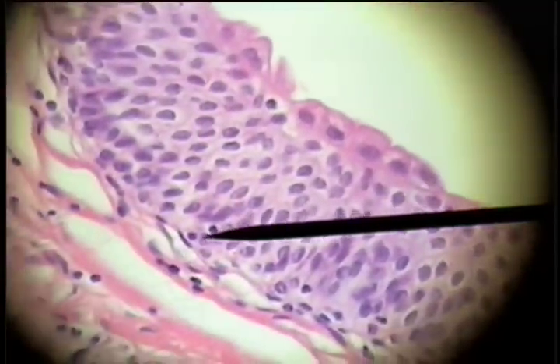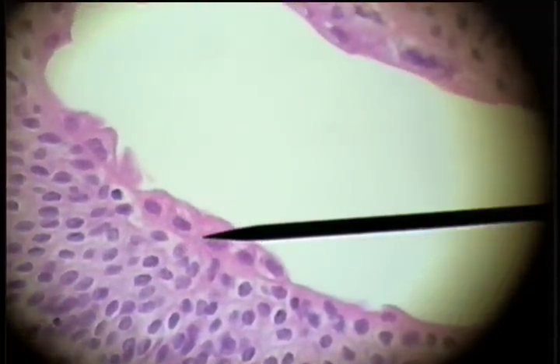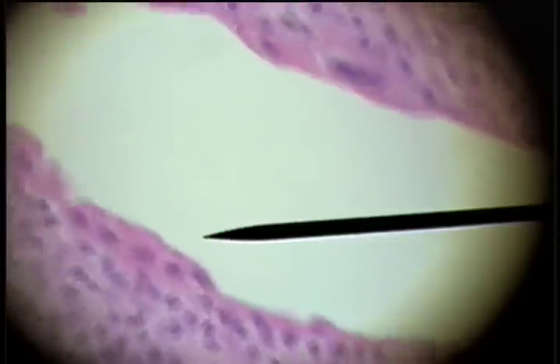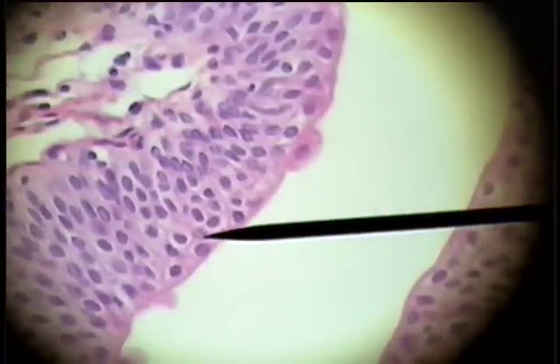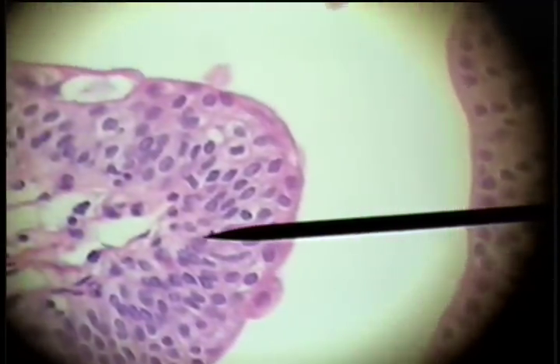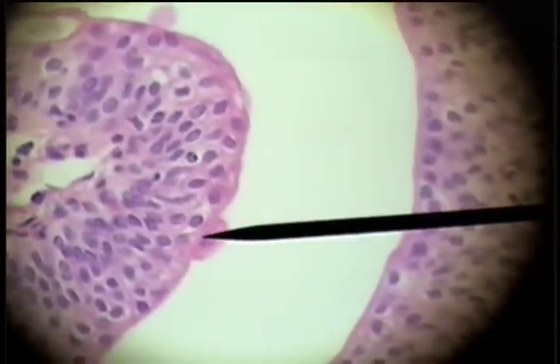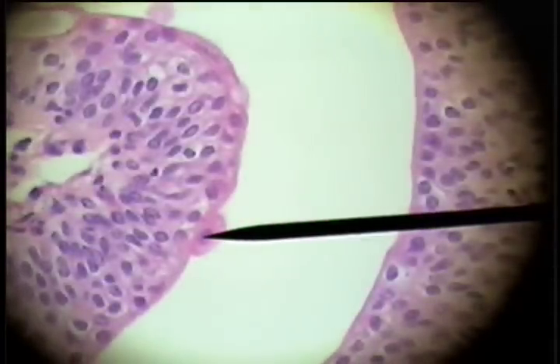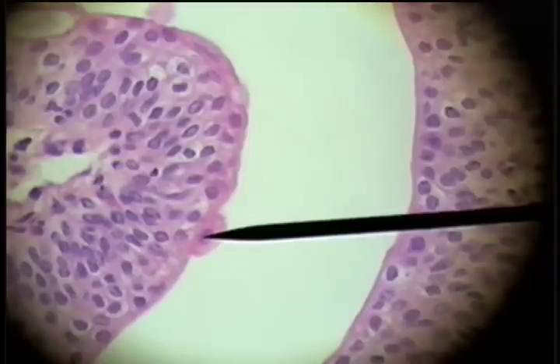We'll see maybe six or seven cells stacked on each other with these large round balloon cells on top, and that's characteristic of transitional epithelium found in structures of the urinary tract. There again is the basement membrane, six or seven cells, and then a balloon cell or large bubble-like cells sitting on the top surface of the epithelium.